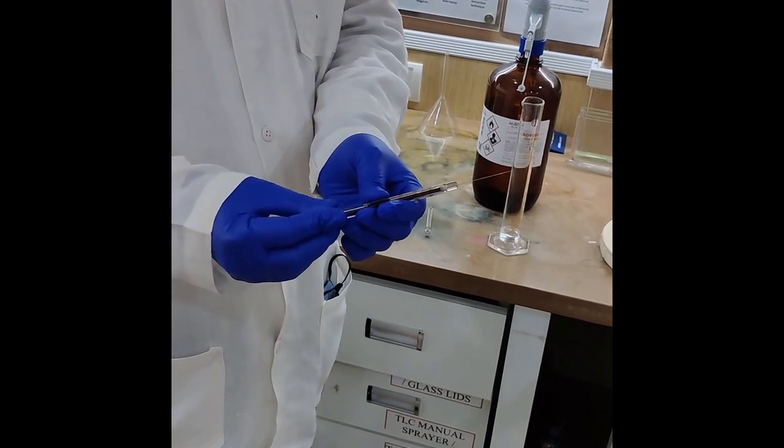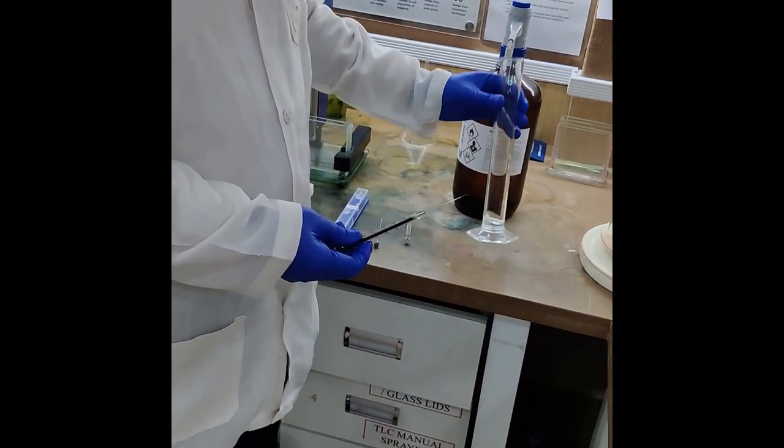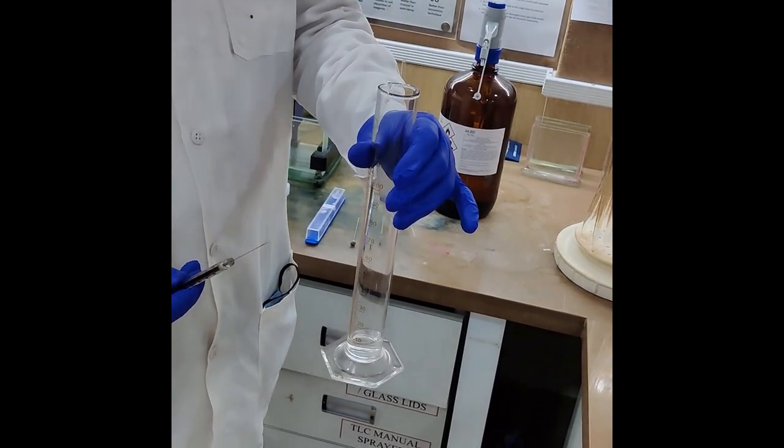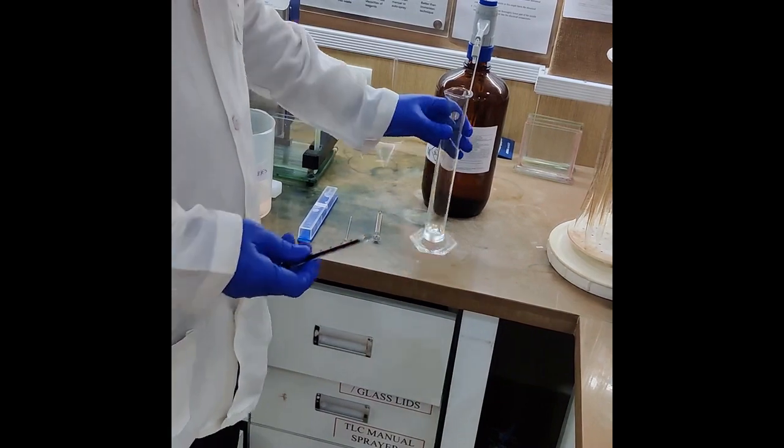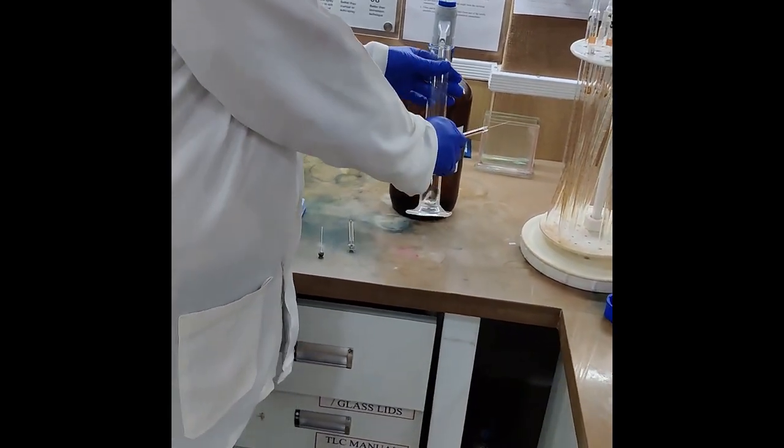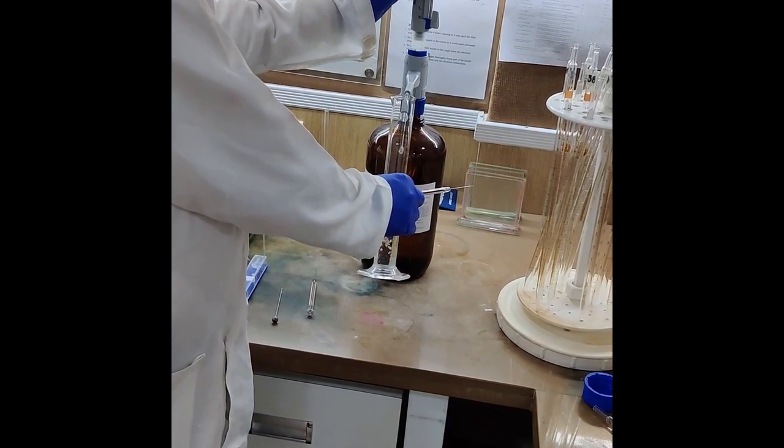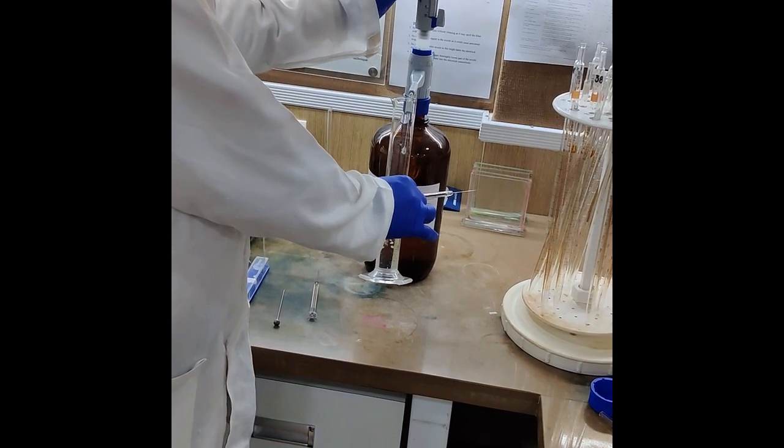In order to remove the block, first remove the piston. Now take another syringe which is in working condition and take a 100 ml measuring cylinder. Add methanol or any other solvent which was last used for the application to the measuring cylinder.